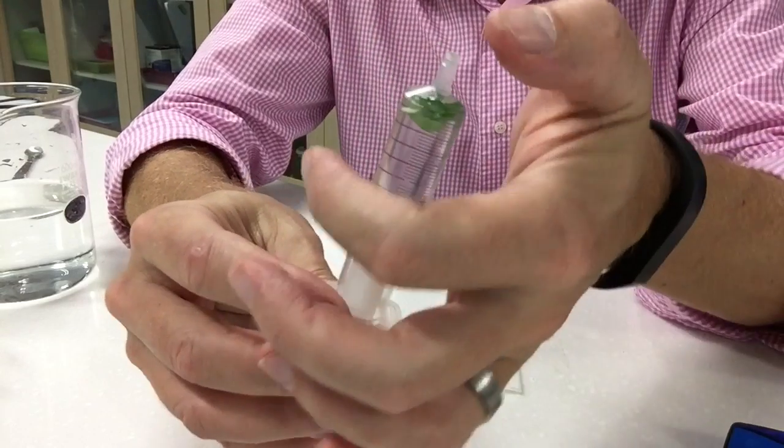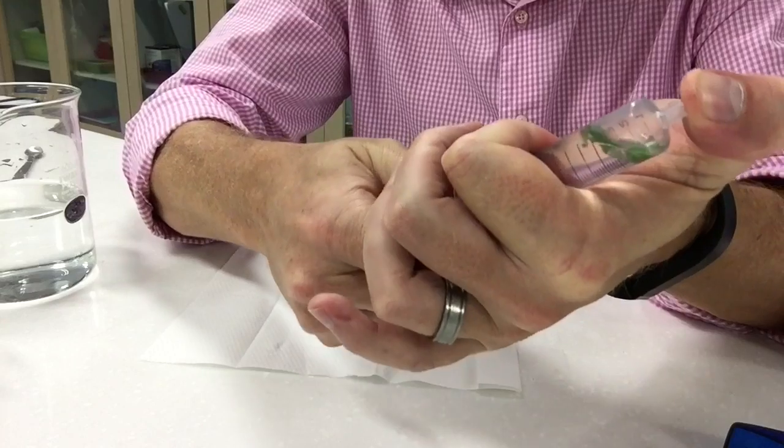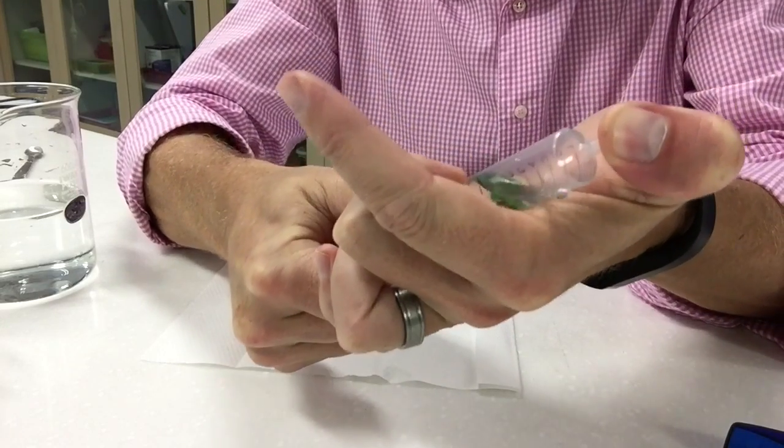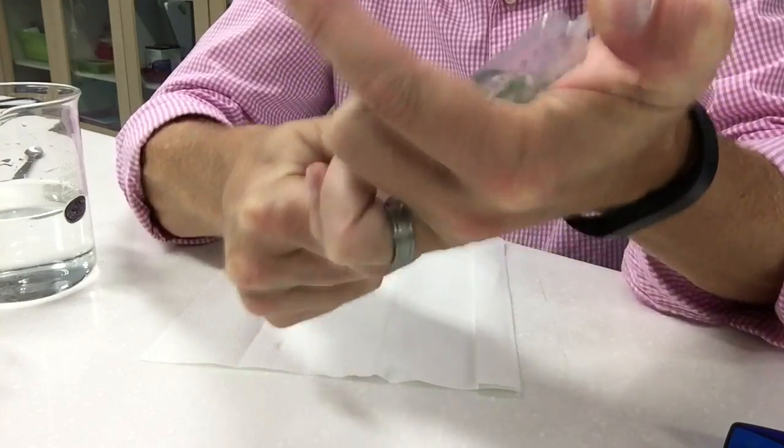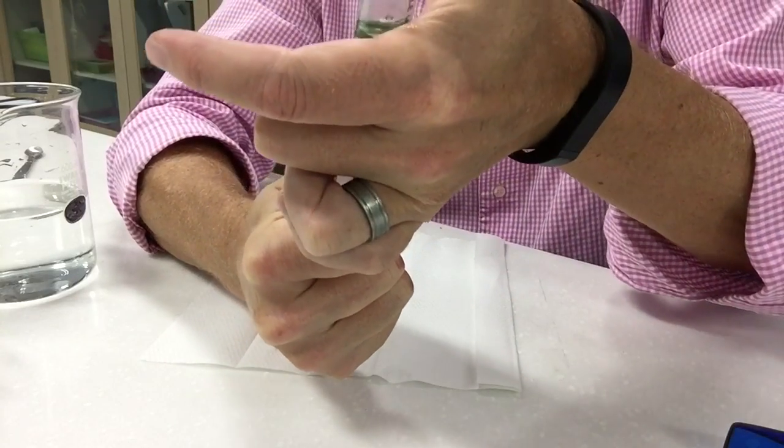Don't squish them against the top there. Put your finger firmly on the edge and then pull the plunger all the way back. Now here's what you need to do as it's like this little hard on the thumb you shake them around a little bit and then let go.